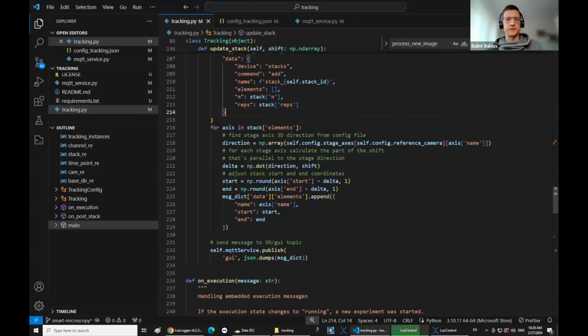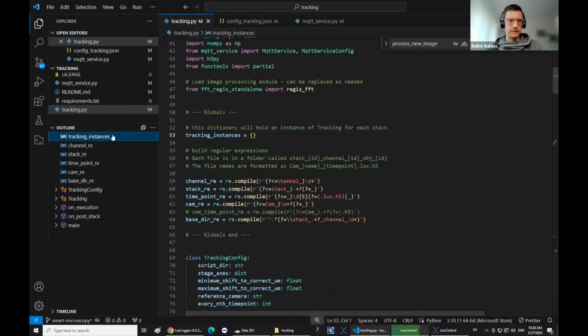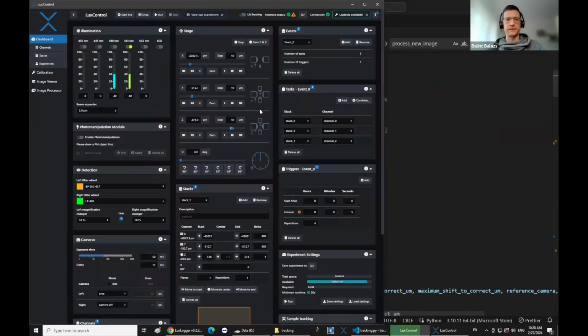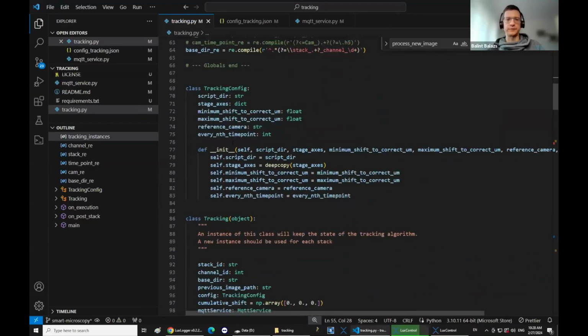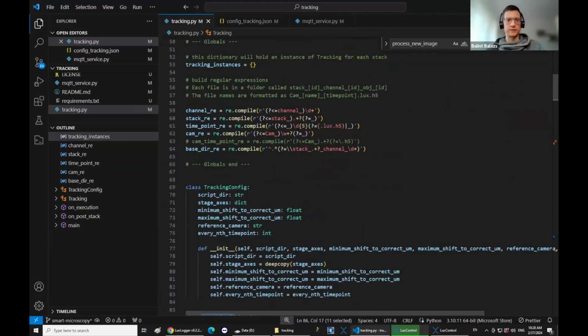And then the script keeps track of each individual stack in these tracking instances. So basically for each stack that you defined in here, the script will start a new tracking, instantiate a new object of the tracking class and keep track of them in here. Is this what you meant, or did I misunderstand it? Yeah, maybe I misunderstood.